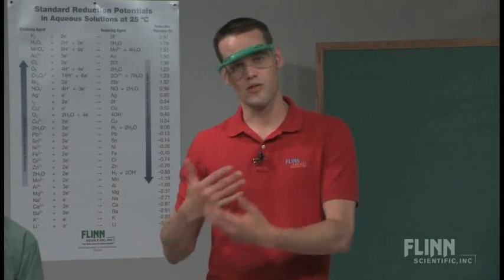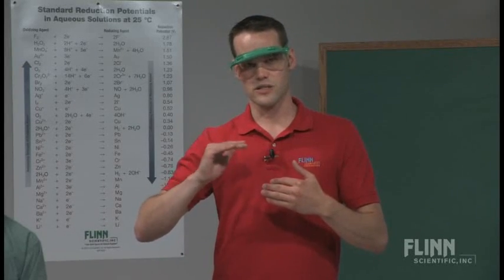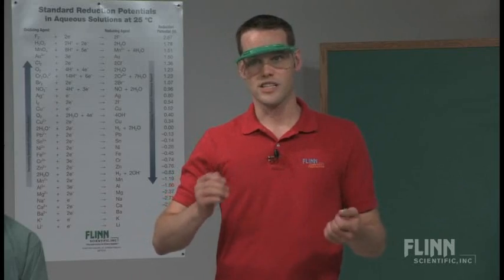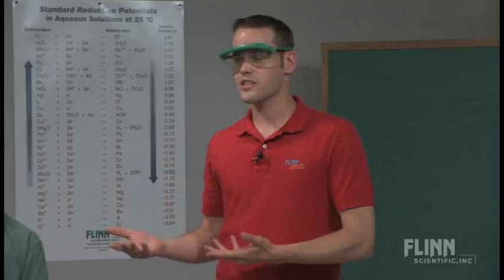It's another way you can take this exact same experiment and spin it into an inquiry lab rather than just a demonstration. You can also use this really nicely for temperature reactions. If you heat this up slightly — don't go beyond 40 or 50 degrees Celsius because it will start to decompose — and put one in an ice bath, you can very clearly show the effect of increasing and decreasing temperature on reaction rate. It's a really beautiful reaction for showing rates of reaction very clearly, and you can spin it into a fun gag for your students.